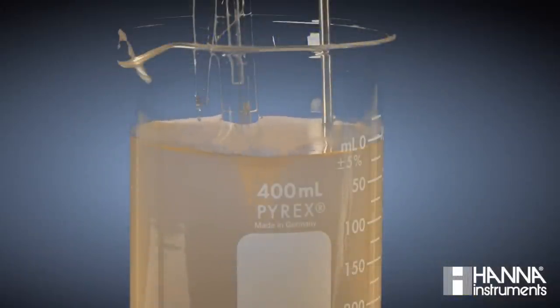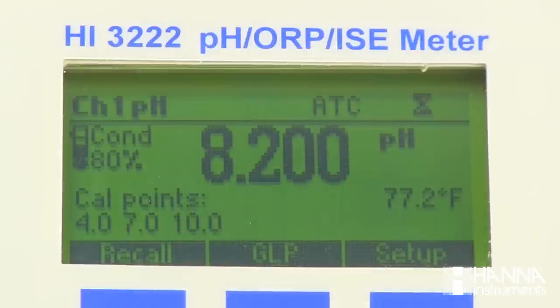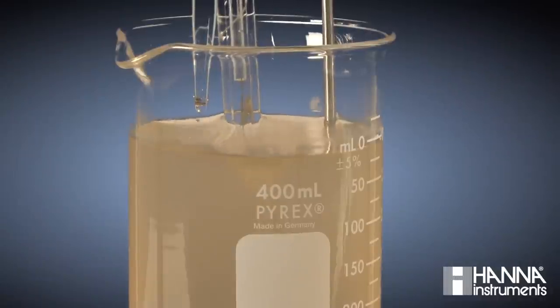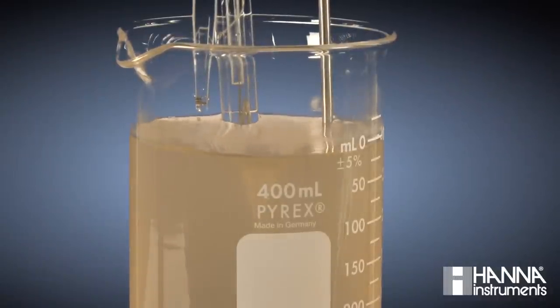As we can see, the pale pink color in our solution is sustained, and our pH has become stable right about 8.2. You may have noticed that the color change is slightly hard to see, especially because of the colored matrix of the orange juice. This is where having a pH electrode and pH meter instead can be an advantage.